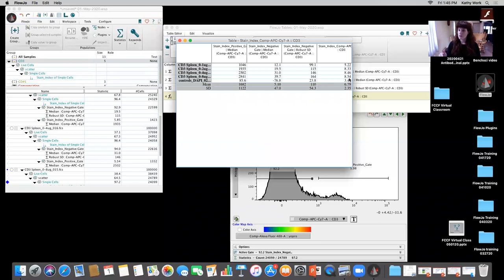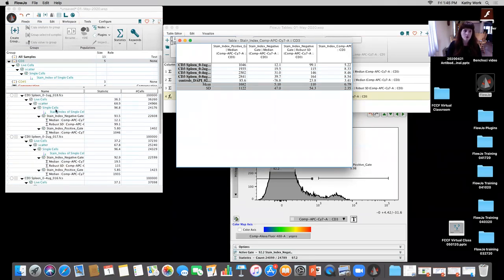So it's never reaching saturation. Our end goal when we're doing titration of antibody is to see the point where our positive is plateauing and the negative starts to come up, and we can tell at that point through the statistical analysis that we've reached saturation. Okay, I can show you all very quickly how we can very easily visualize that.